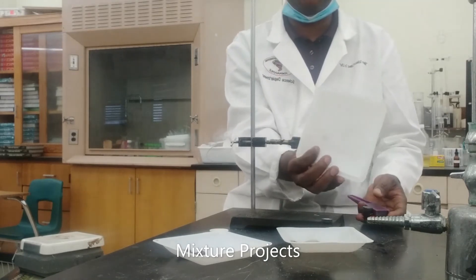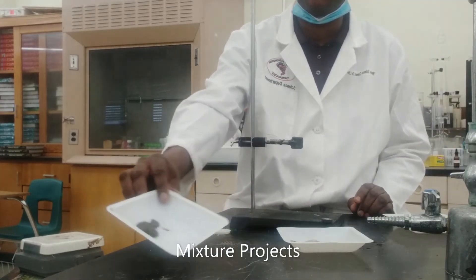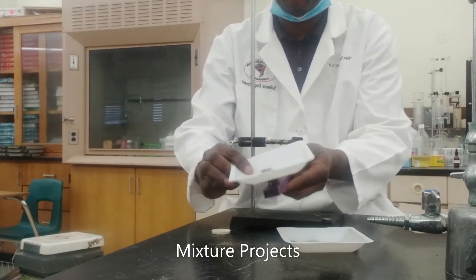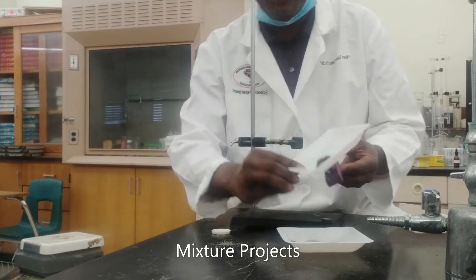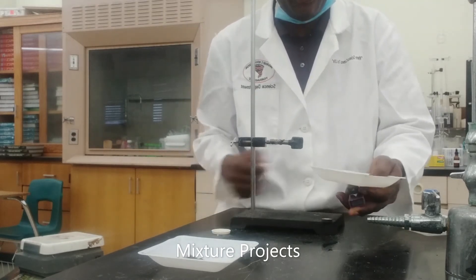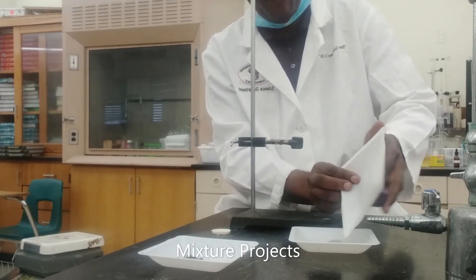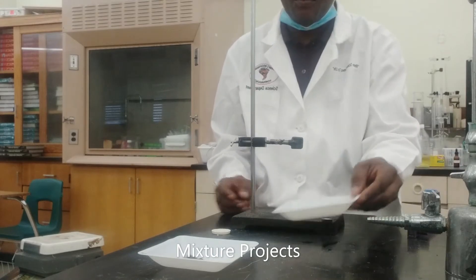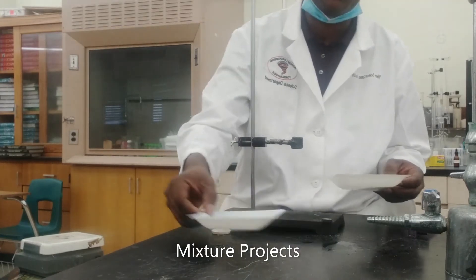Right, so you notice we don't have any more iron. We've succeeded in separating our iron — all of that is iron. I think I still have a little bit of the sand and salt mixed in, but we've separated all the iron. No iron left there. We've succeeded in getting our iron filings separated from the mixture, so I'm gonna set this aside.